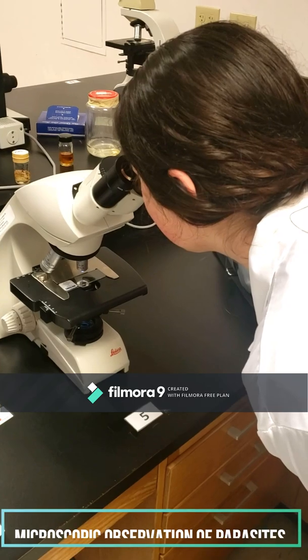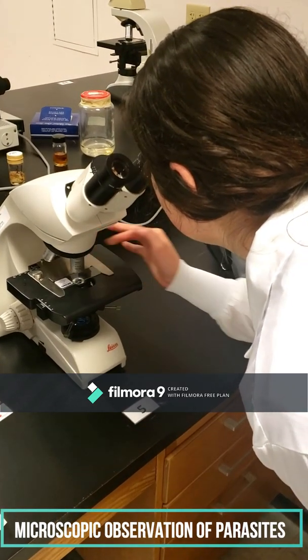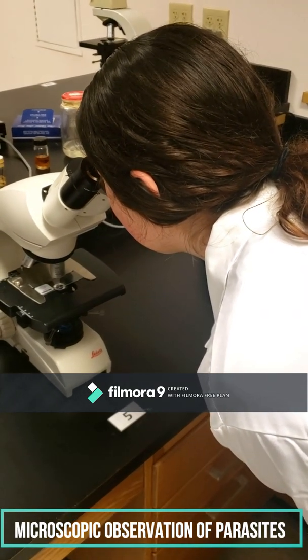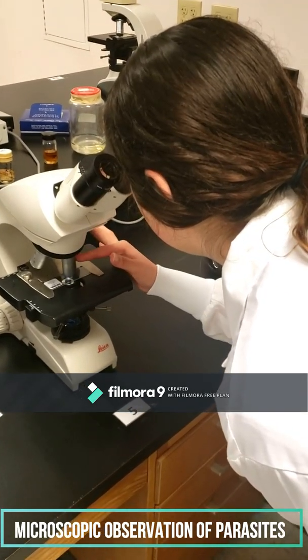You are at 4x right now. You can go into 10x and magnify the field, and you can see the uterus and the eggs. If you go deeper into 40x, then you will see the structure much bigger. And I think that's the best image of the Ascaris eggs.